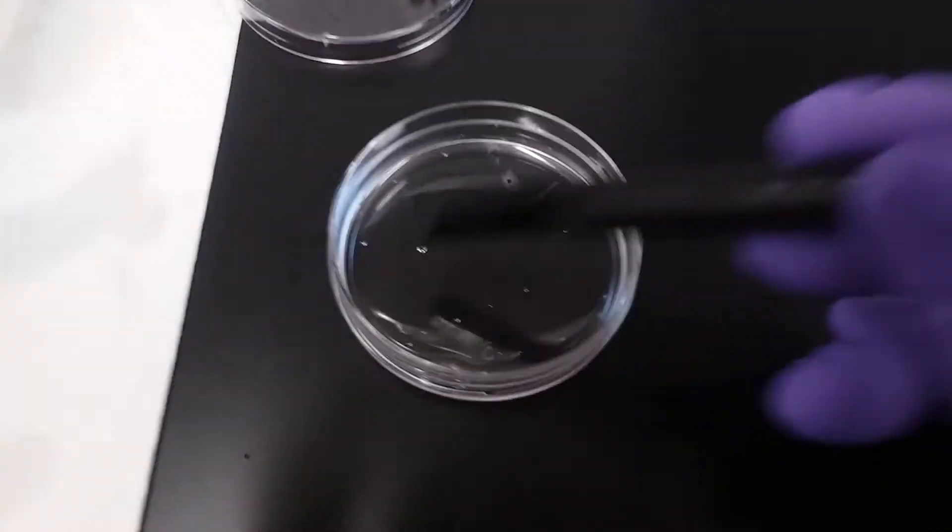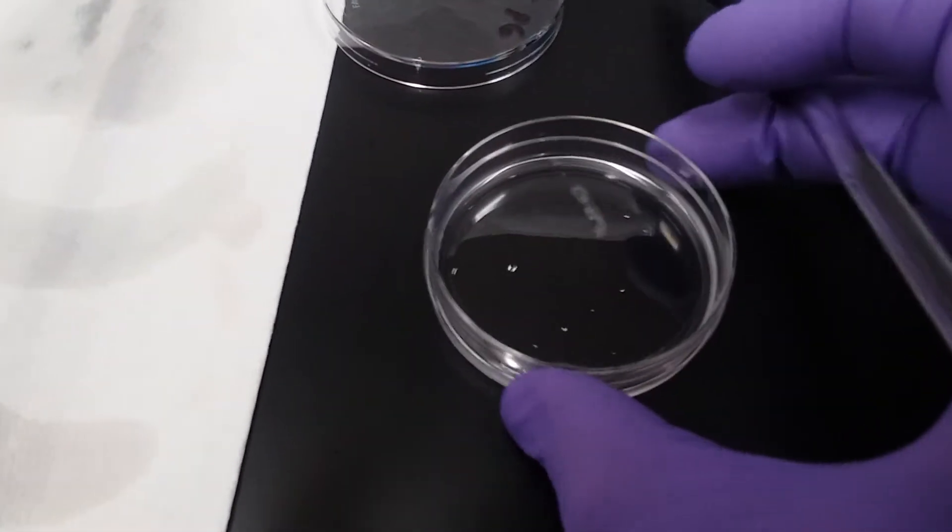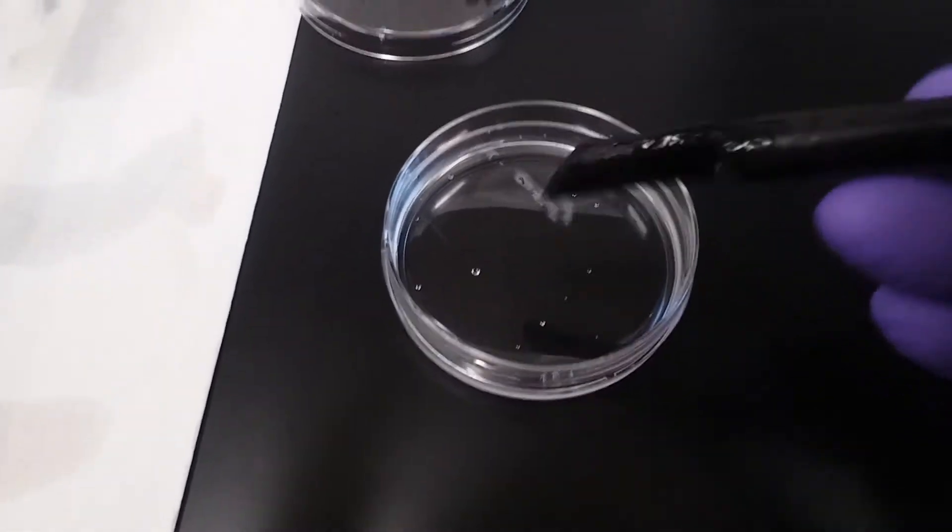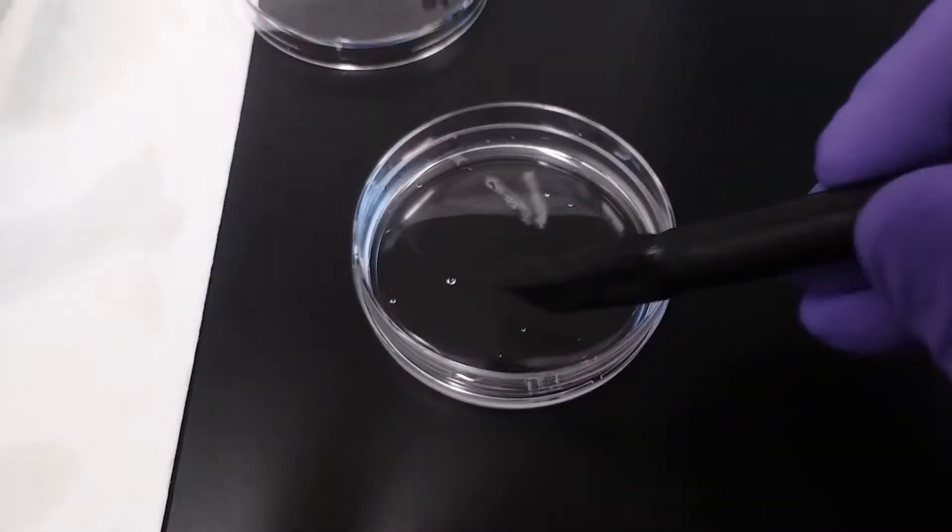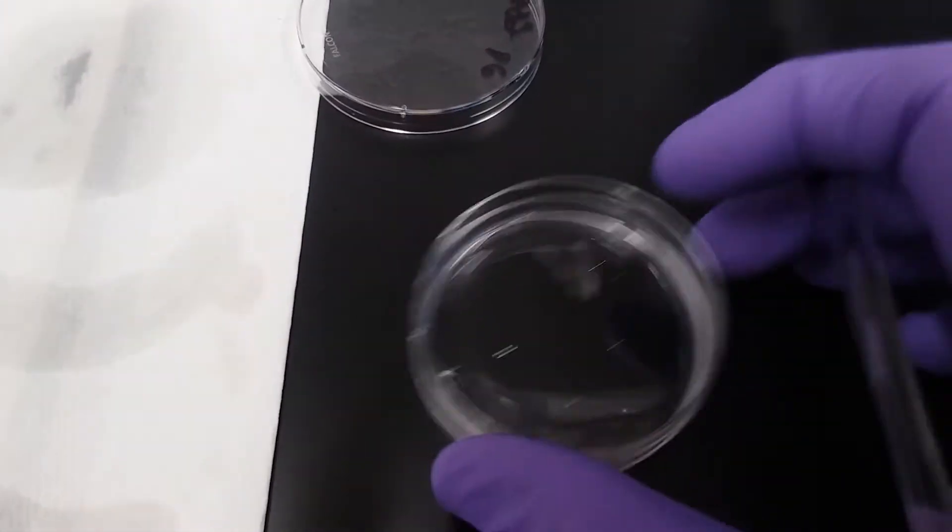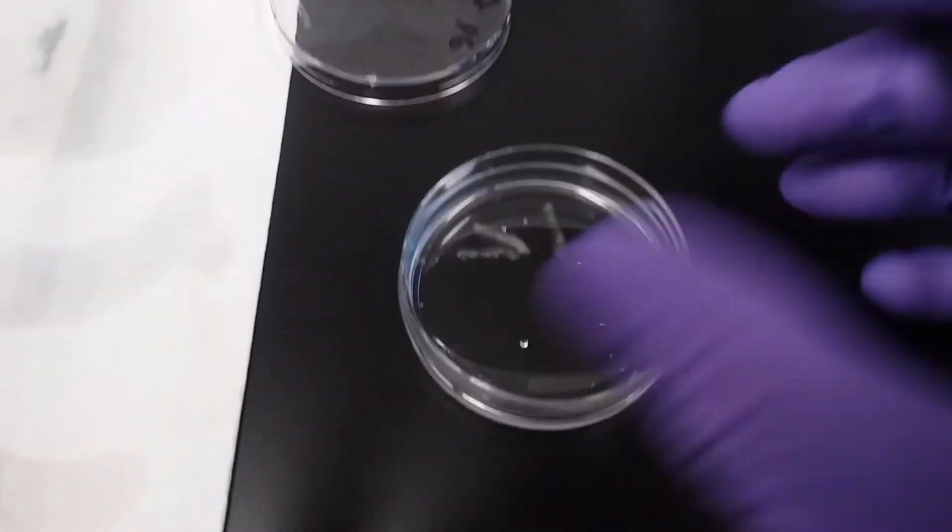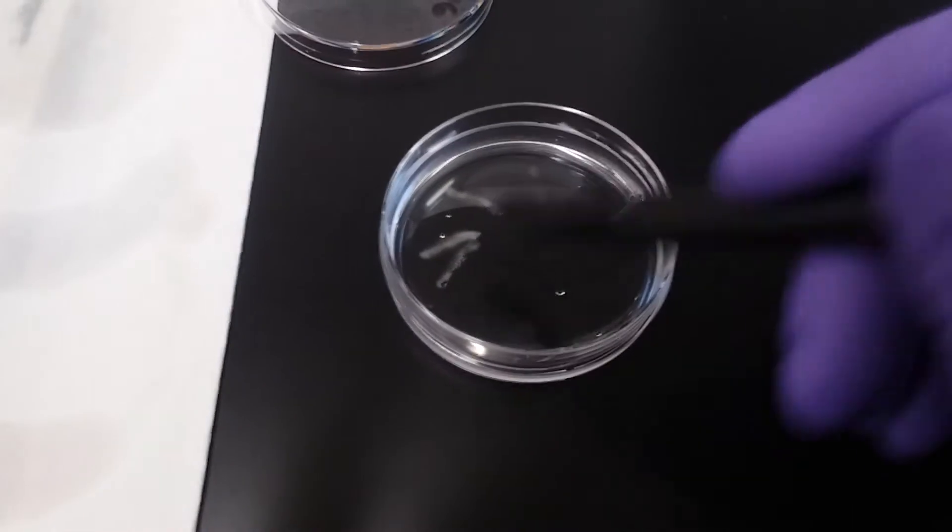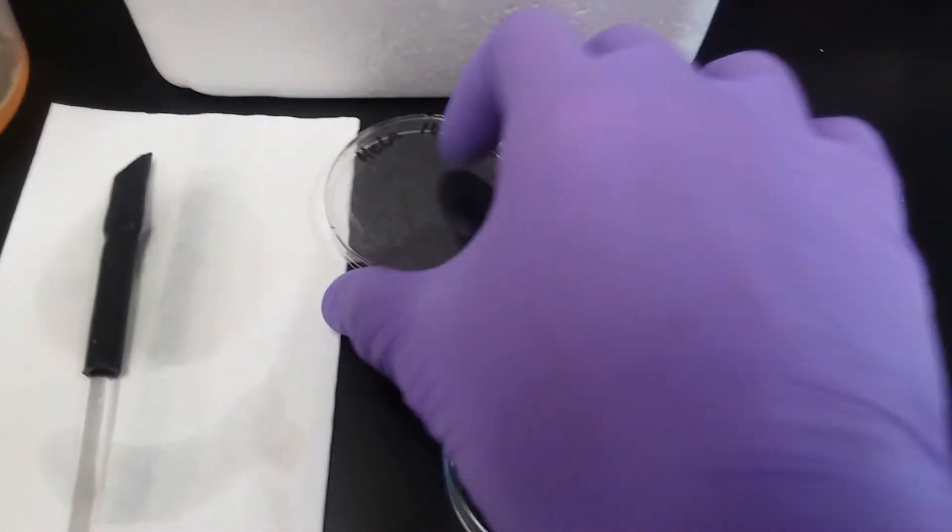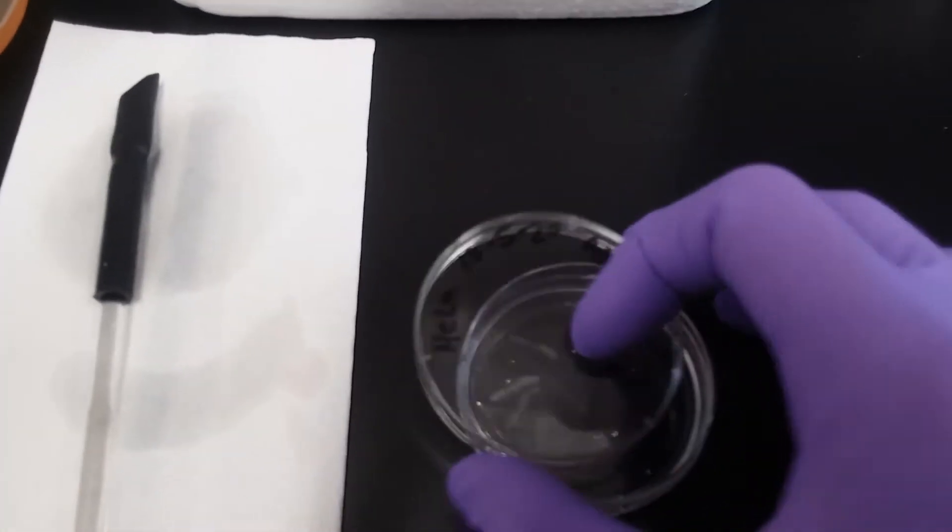And I will once again scrape across the plate, turn it, across the plate, turn it, across the plate, and back on ice you go for another five minutes. That's called babysitting your cells.